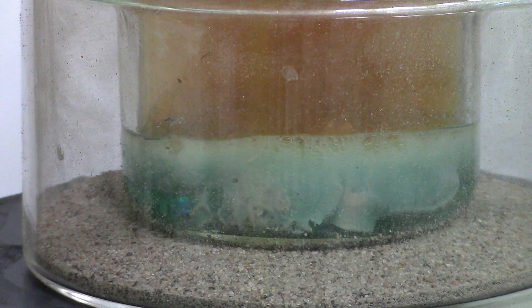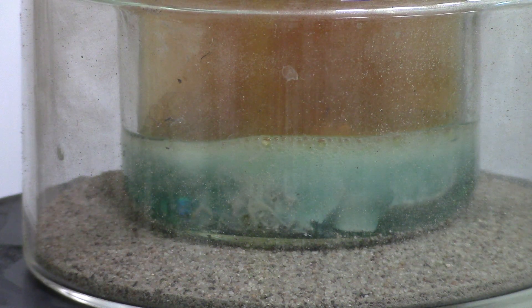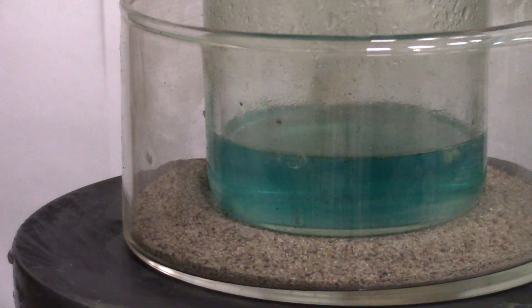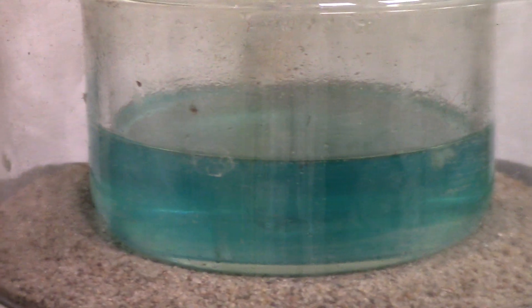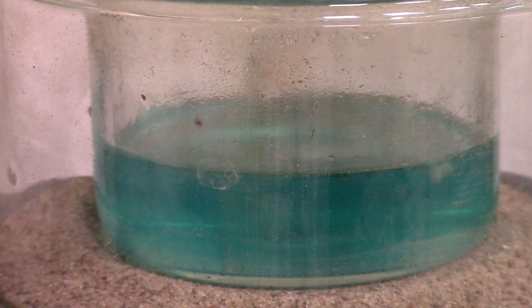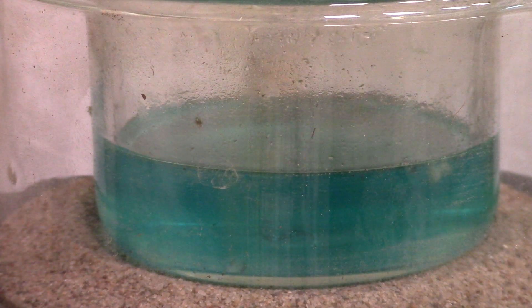Our process stops when most of the initial material has been dissolved and nitrogen dioxide doesn't bubble too much. Here we go — around 99% of silver has reacted. I dare say those little pieces are just steel clasps from chains.